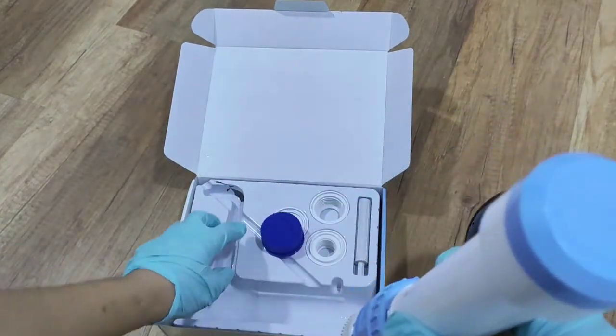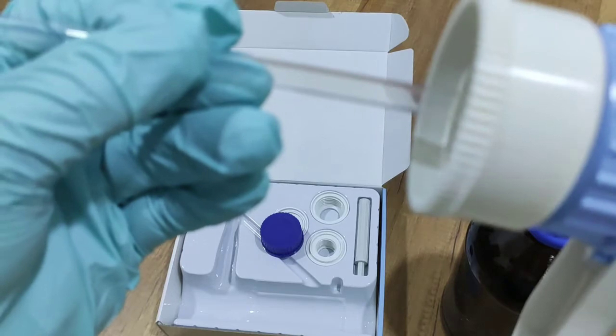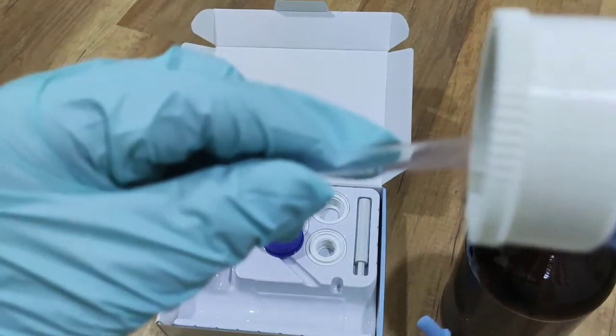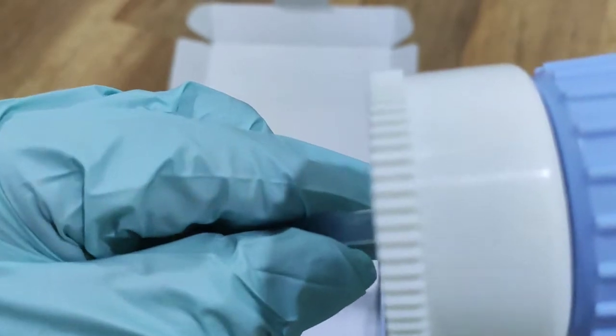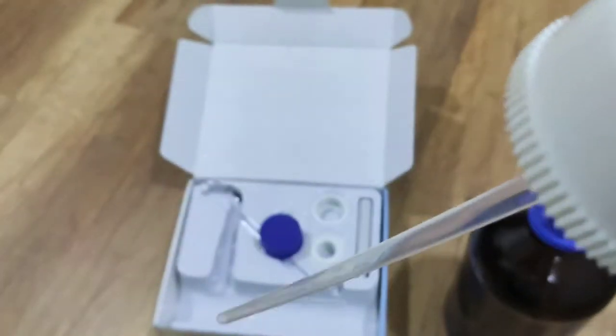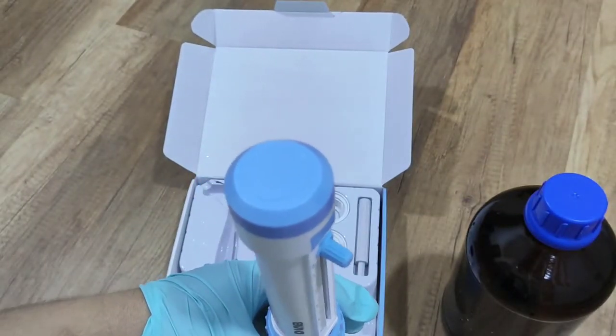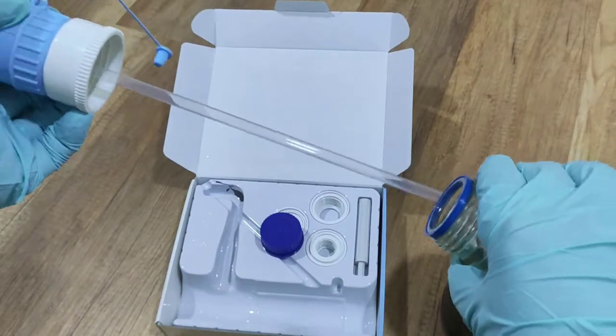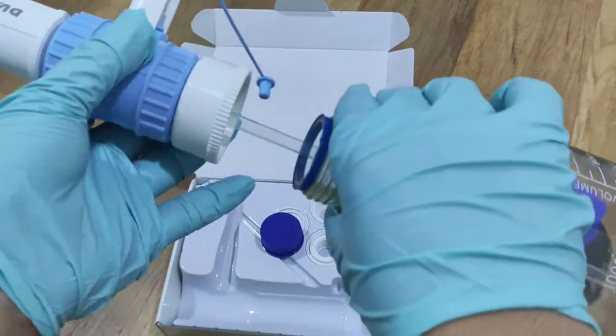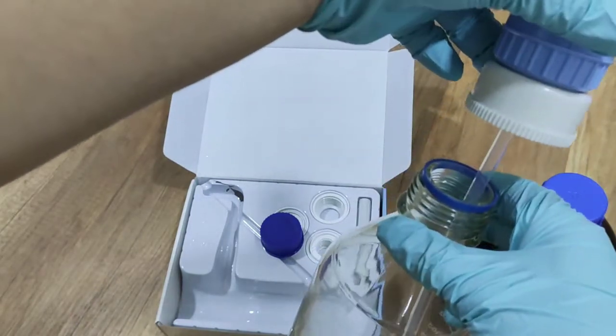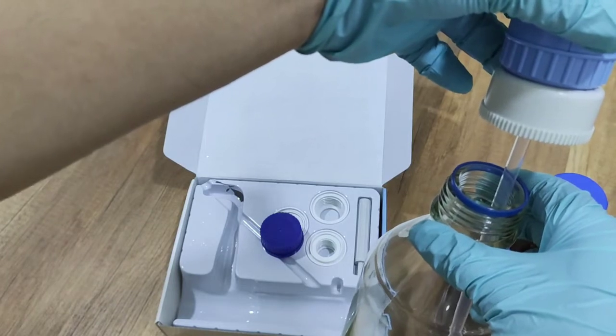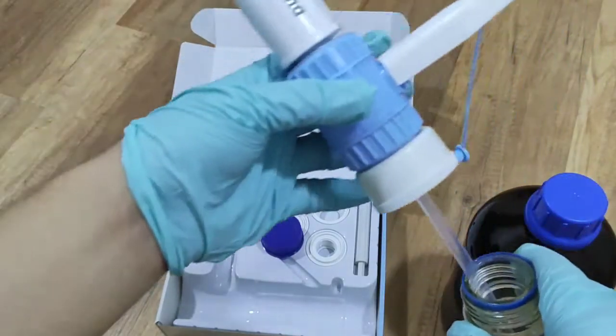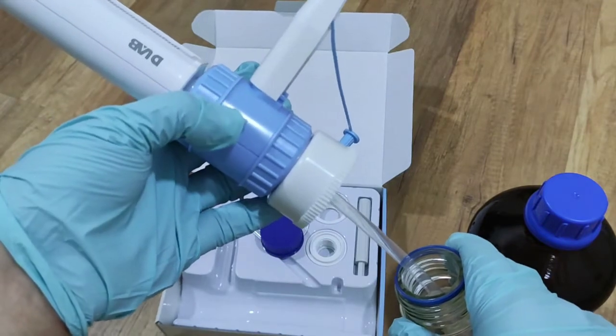We need to put on the pipe, the pipe connection, and the bottom here. We connected it on. And then we reach to the bottle. But apparently, this pipe is too long for this bottle. You can see? It's too long here. So we need to cut it until it fits to our bottle. Even we can use other silicon pipes, whatever pipes to connect. It depends on the availability of the pipes in your place. You can choose.